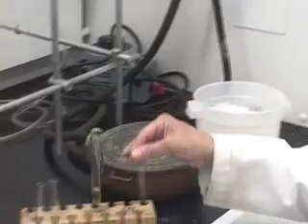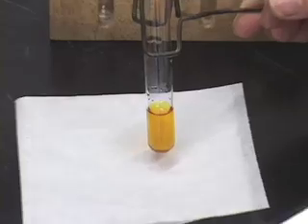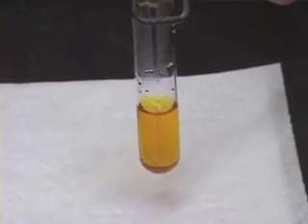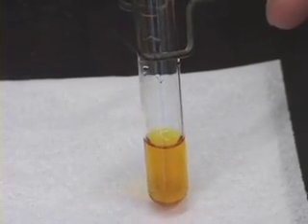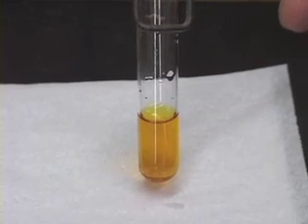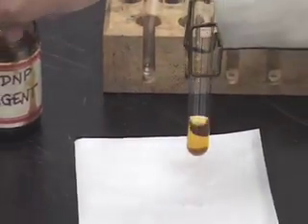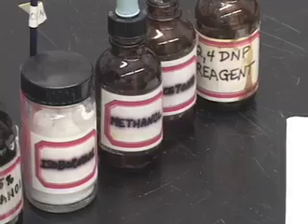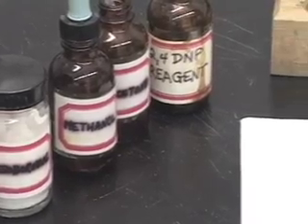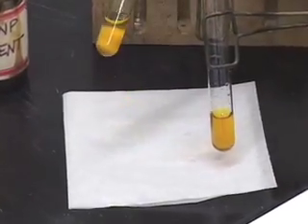After cooling in the ice bath, we take the test tube out — still no precipitate. We added all the reagents, heated in the steam bath for a minute or two, then cooled in ice, but still no precipitate, confirming the negative test result. The compound tested was methanol, which is an alcohol and should not give a positive result. The positive test result was for acetone, which is a ketone — we got a yellow precipitate. Negative for the alcohol, no precipitate.